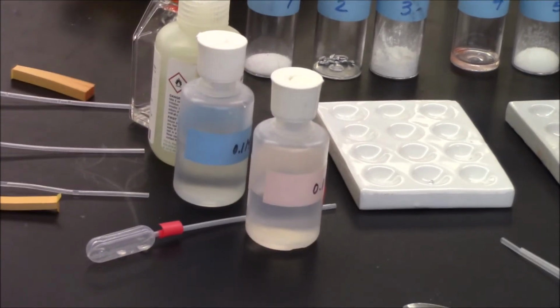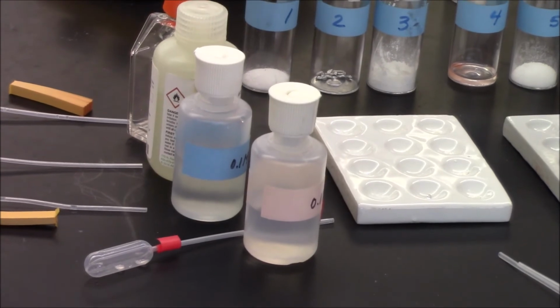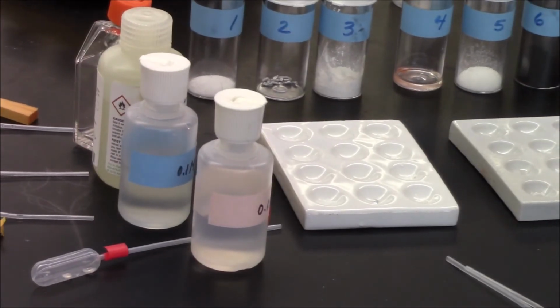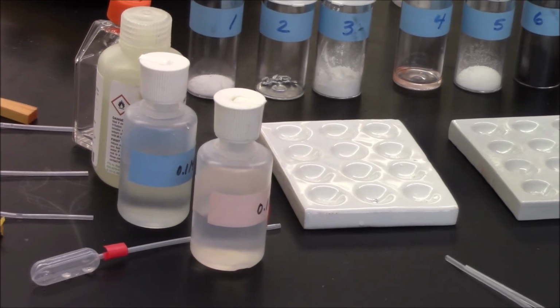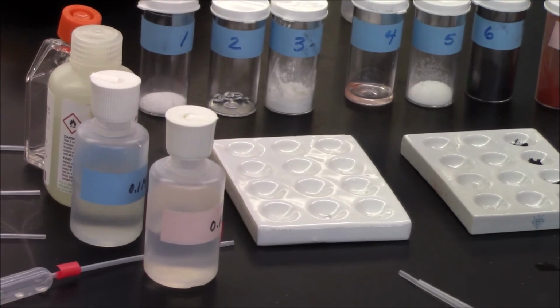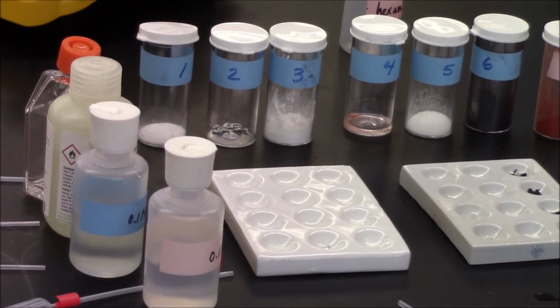And I'll also be checking for the reactivity with an acid. Because none of these are bases, there'll be no acid-base reaction, so I don't necessarily have to check for pH. But maybe, knowing my characteristic reactions of certain substances with acids, I could be on the lookout for some bubble formation.